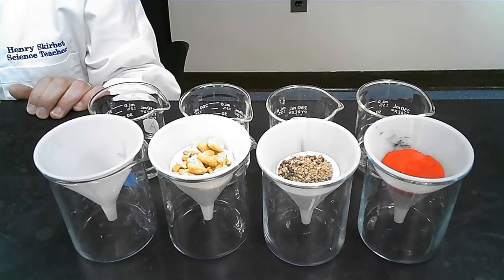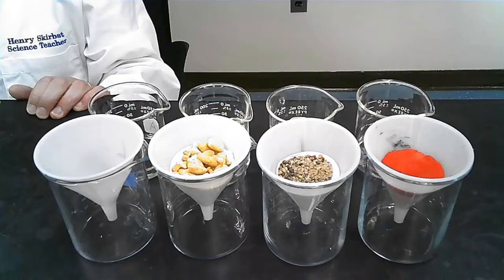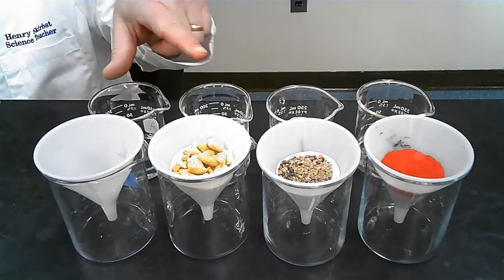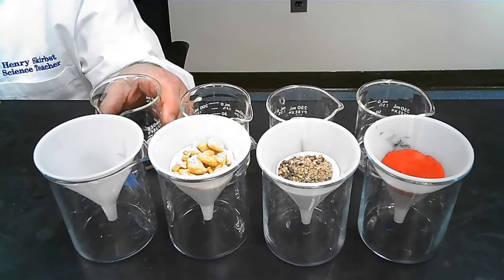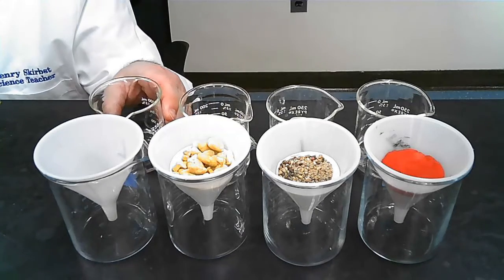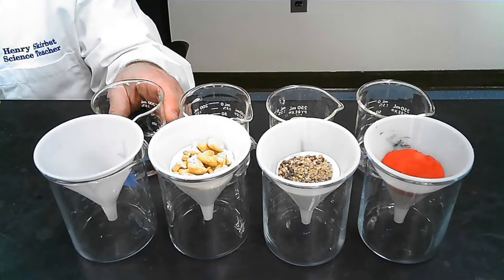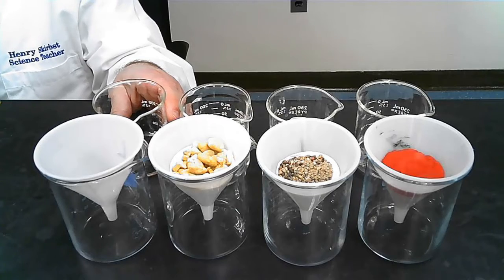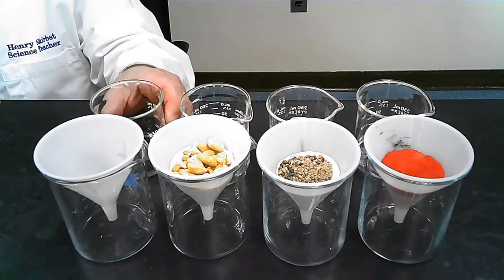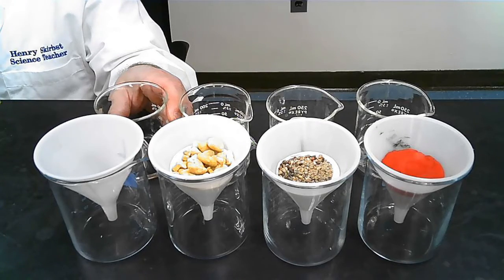Make sure you record this in the correct order in your book. I'm going to do it in the order I have here, so I'm going to begin with just the air. By the way, I would suggest watch all 4 of them before you write down any words. Are you ready? And if you need to, you can rewind the video and watch again. Remember your choices, fast, medium, slow, or never.